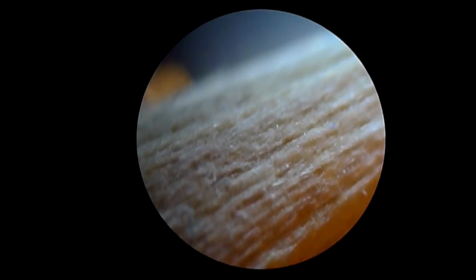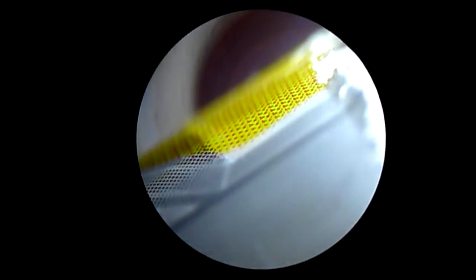I'm finally getting roughly used to this stage and how to control it. A bit back to front. This looks like a label here. So I'm operating with this LED with one hand and focusing with the other.